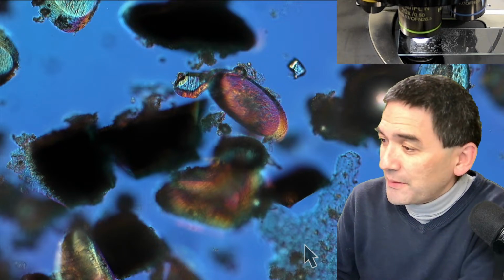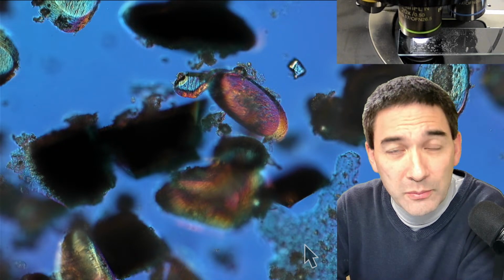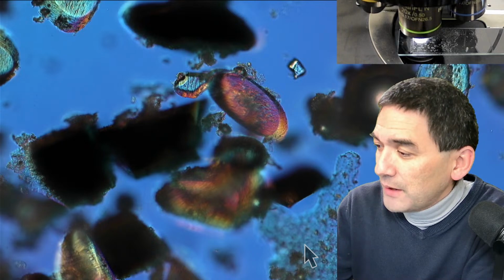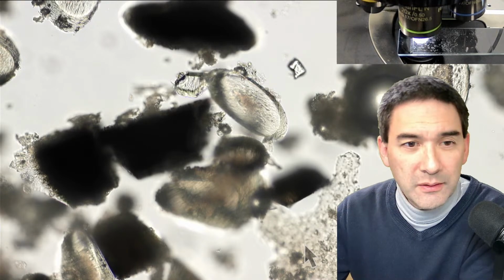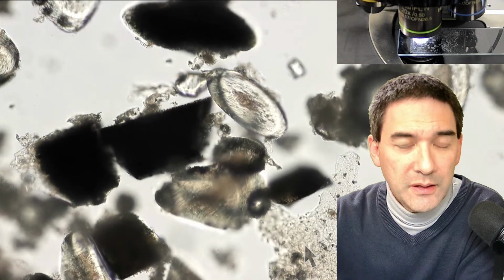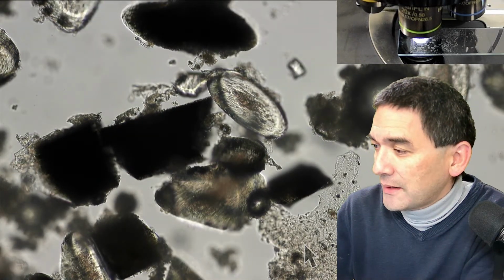I want to show you something else right now. Many people have been asking me, what about the colors? I've got special optics on my microscope that make colors like this. If I remove the filter, then this is basically bright field. So these are the natural colors, so to say. You can of course adjust the contrast here as well. Let's have a look at this using phase contrast as well.